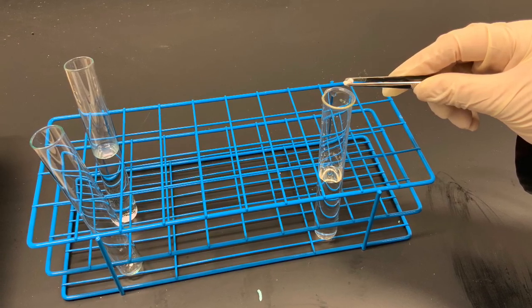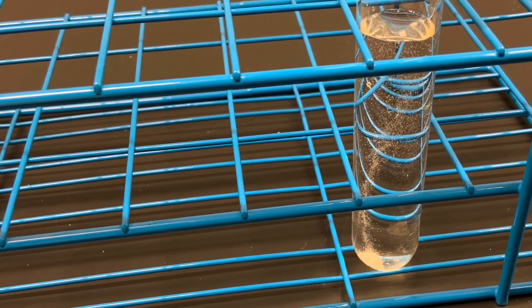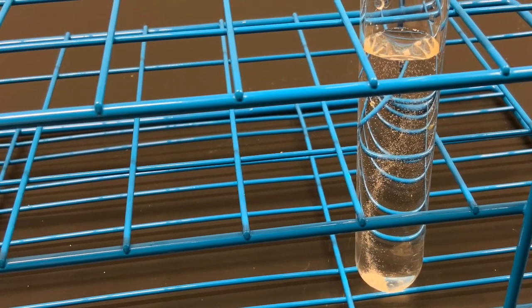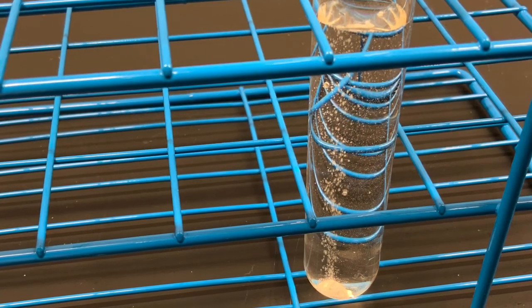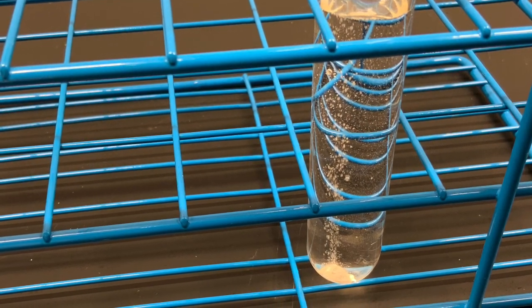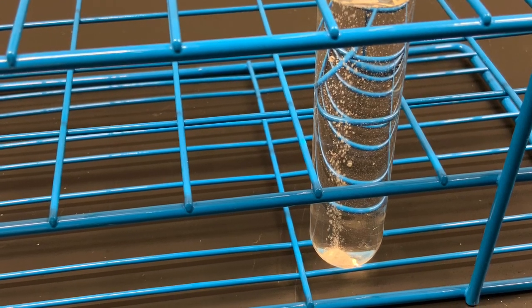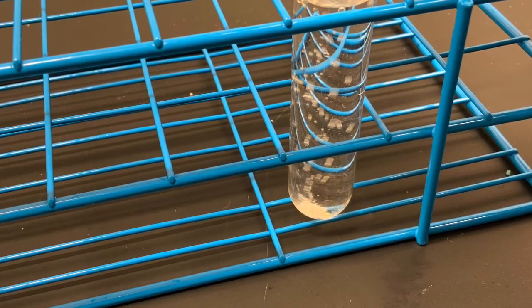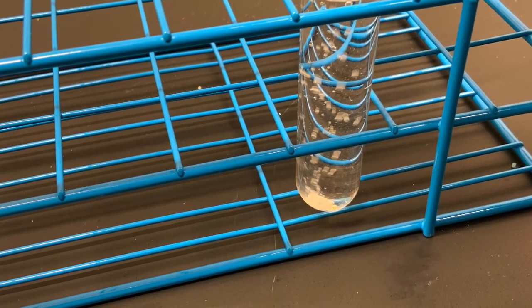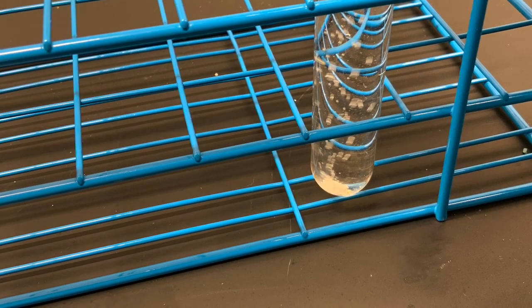Watch what happens when a small piece of calcium is dropped into a test tube half filled with water. The calcium surface has a hard coating of corrosion products, and it takes a few seconds for these to dissolve. So initially only small spots of calcium react, forming only a few small hydrogen bubbles. When all the pure calcium is exposed, the reaction occurs more vividly and larger hydrogen bubbles are forming.